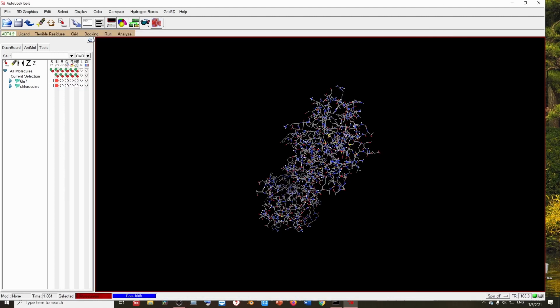Hello everyone. In this video we will talk about an error that sometimes pops up when you try to dock using AutoDock Tools. I'm talking about MGL tools. Let me first show you the error.